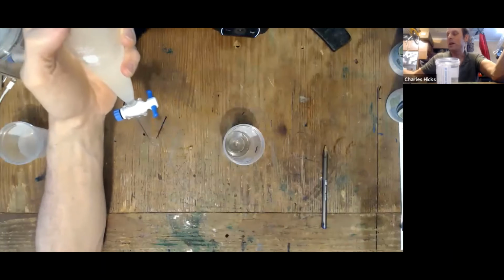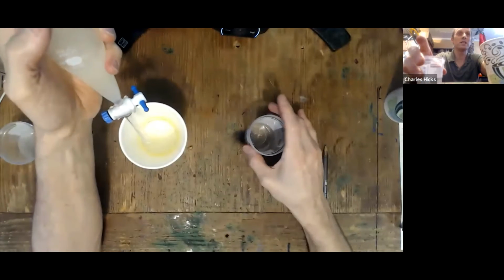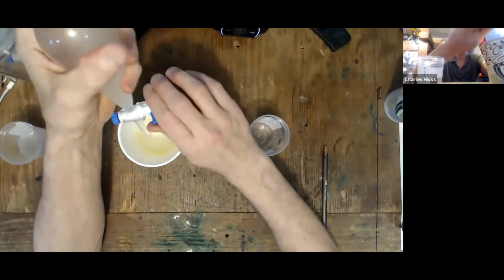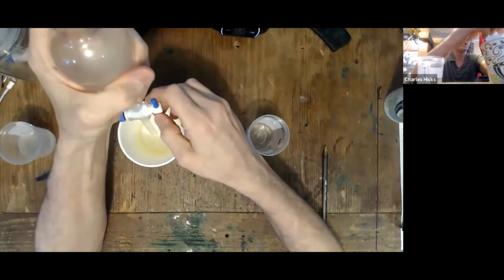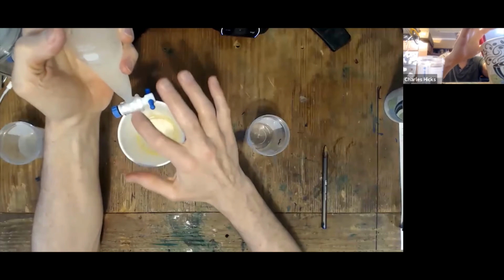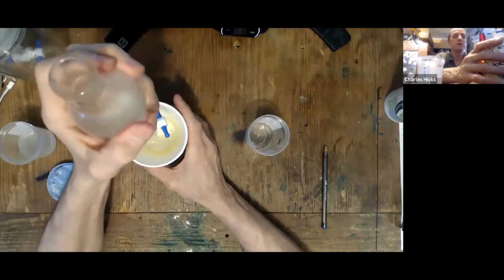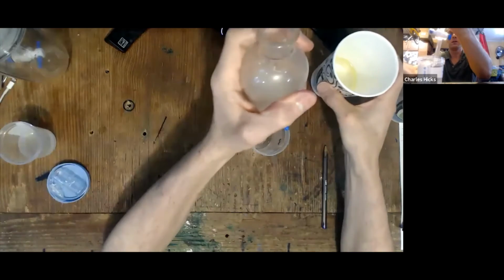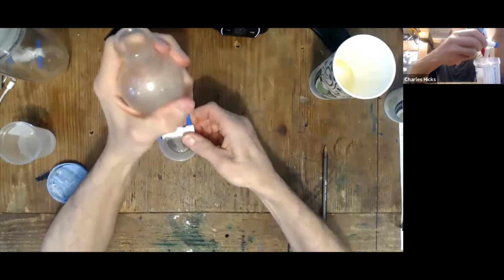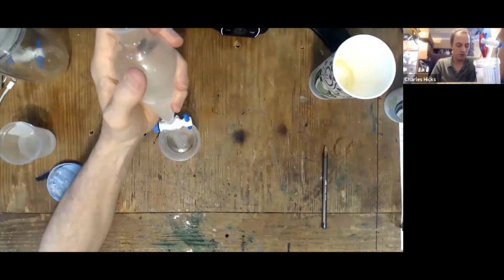But before I do that, I want to wash the emulsion out of the separatory funnel into the waste container. So make a waste container with a coffee cup at your station and drain off beyond where you see the oil go through. I just drain some extra oil through to wash that off. Now I'll drain the rest of the canola oil off here, and I know I won't have drawn any of the emulsion up. This takes a while to drain, so I'm going to pause the video.